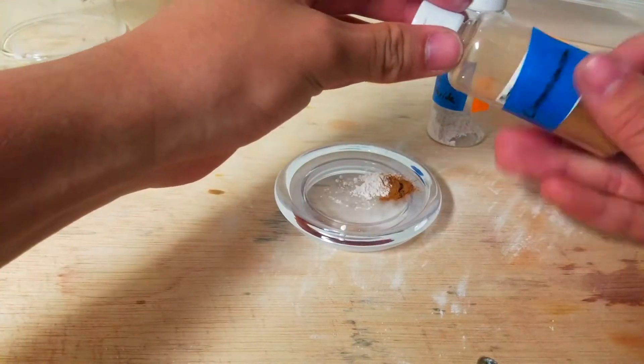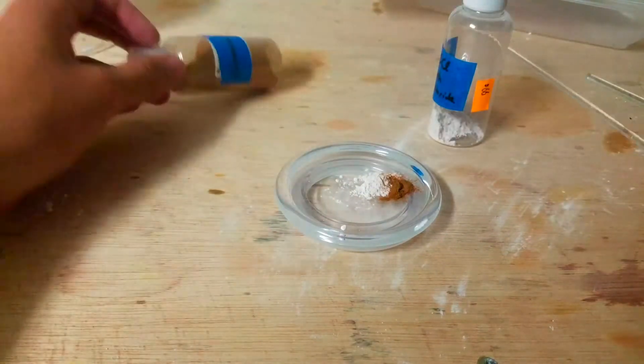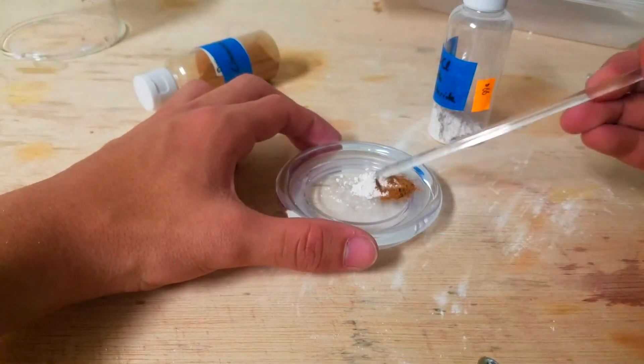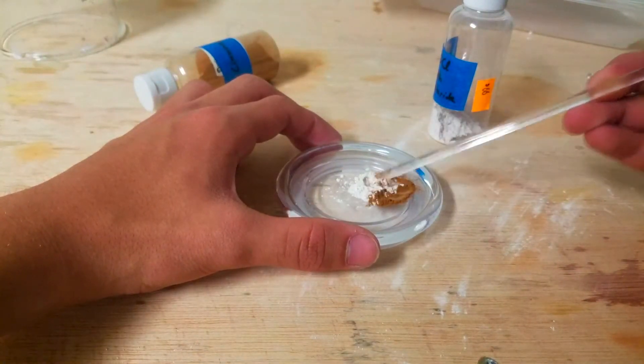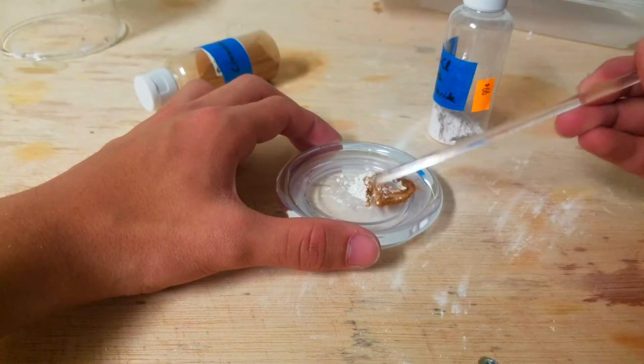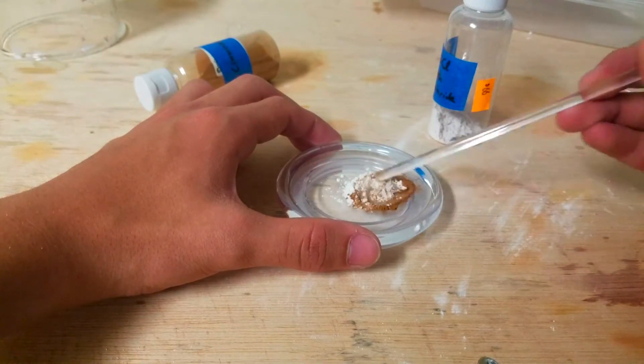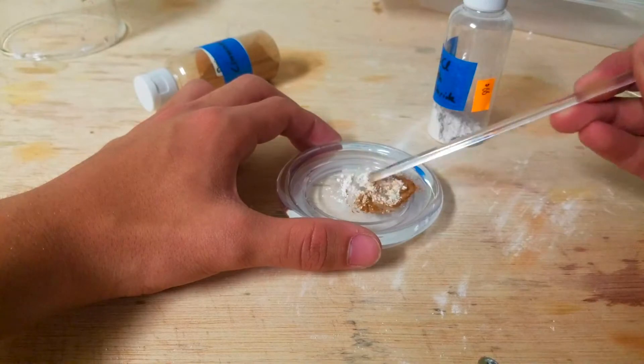Although it is a relatively useless substance, I had some bismuth metal sitting around in my lab for about a year and I wanted to finally do something with it. I decided that making bismuth oxychloride would be a relatively painless process, but later on I was soon met with issues that made it honestly kind of a pain to do.